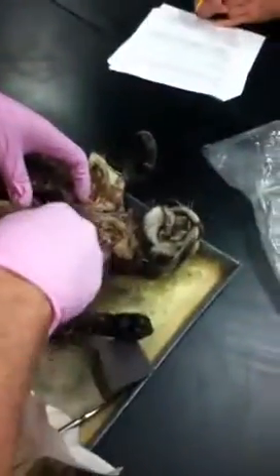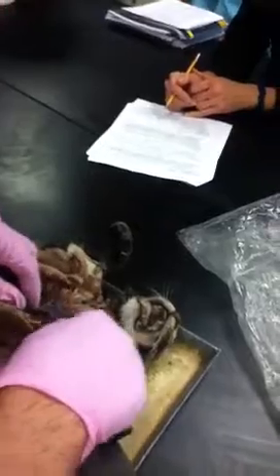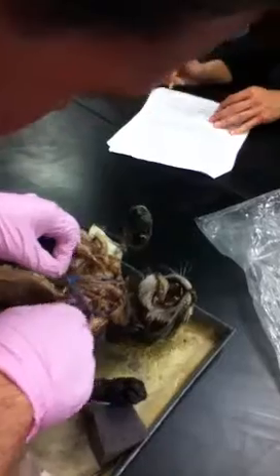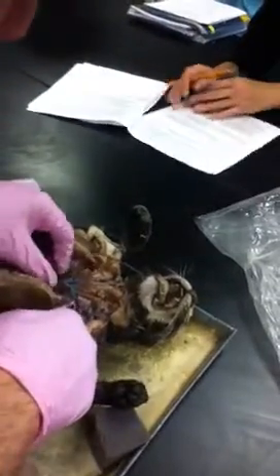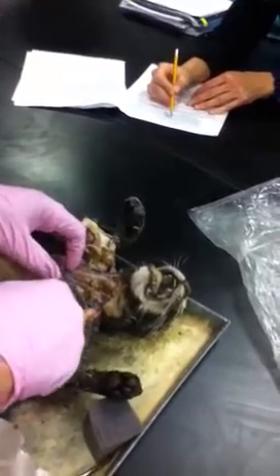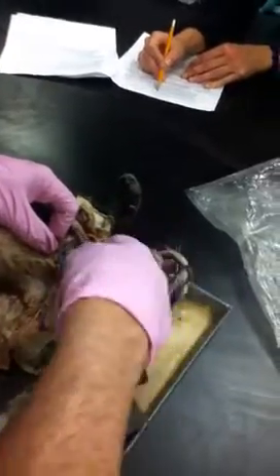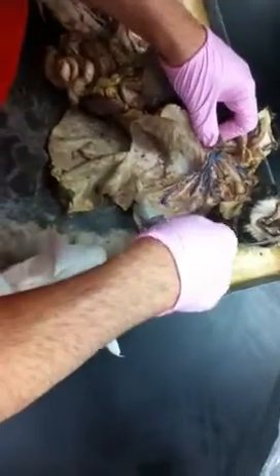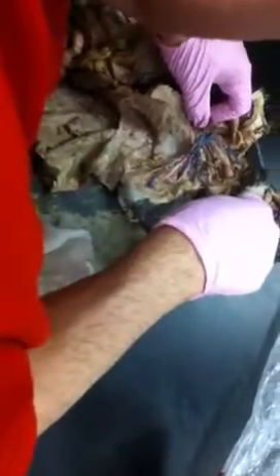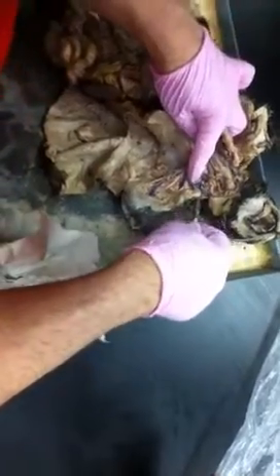Superior vena cava branching into our brachiocephalics, correct? So we got our superior vena cava branching into our 2 brachiocephalics. Then we're going to go on this side. We've got our 2 brachiocephalics, and this little subclavian guy here. The only one we can see is that external jugular. On this cat, we actually can see the internal jugular, as Erica pointed out.